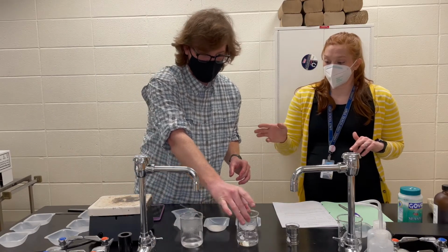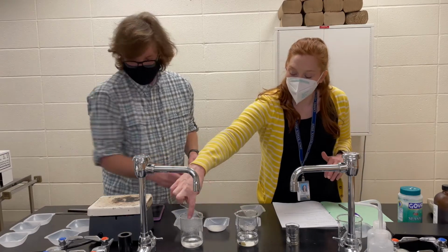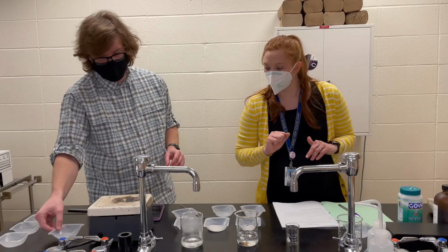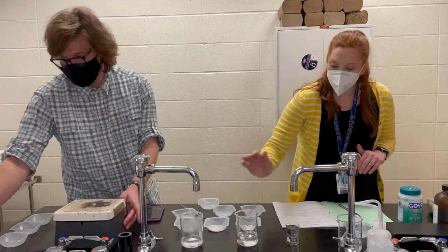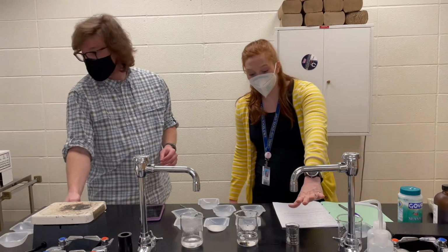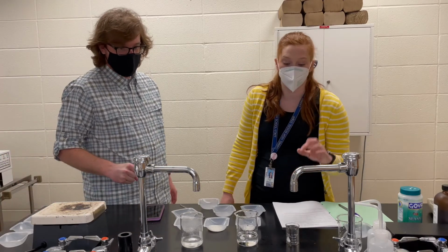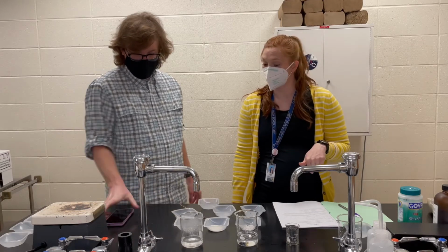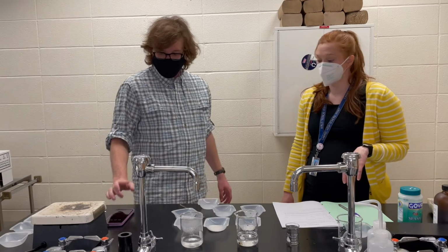So Mr. Sharky just pulled off some water that has been heating up on a hot plate. I hope that you can tell that there is some condensation around the top of the beaker, showing you that some of it has started to evaporate. Right here in the middle, we've got room temperature water that just came straight from the faucet. And then in our 3rd beaker here, we have some water that came from an ice bath, a beaker in the sink that's got a mix of ice and water. So that's gonna be cooled down. You're gonna have to take our word for it that these are at different temperatures.